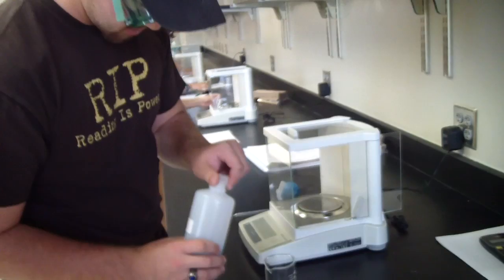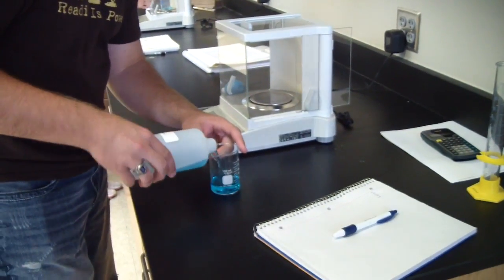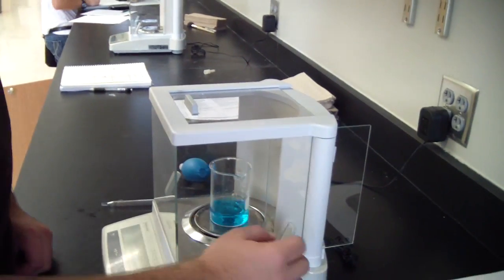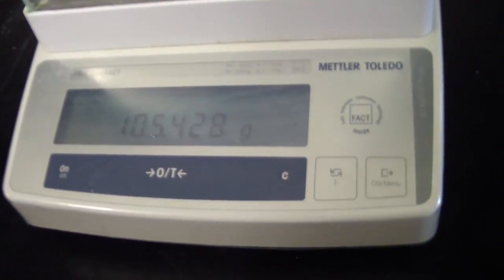Now we're going to find the mass of the beaker along with a small sample of the solution. Once again, you add the solution to the beaker away from the balance, not while it's still in. Carefully place it inside, gently close the window, and the mass of the solution with the beaker is 105.428 grams.